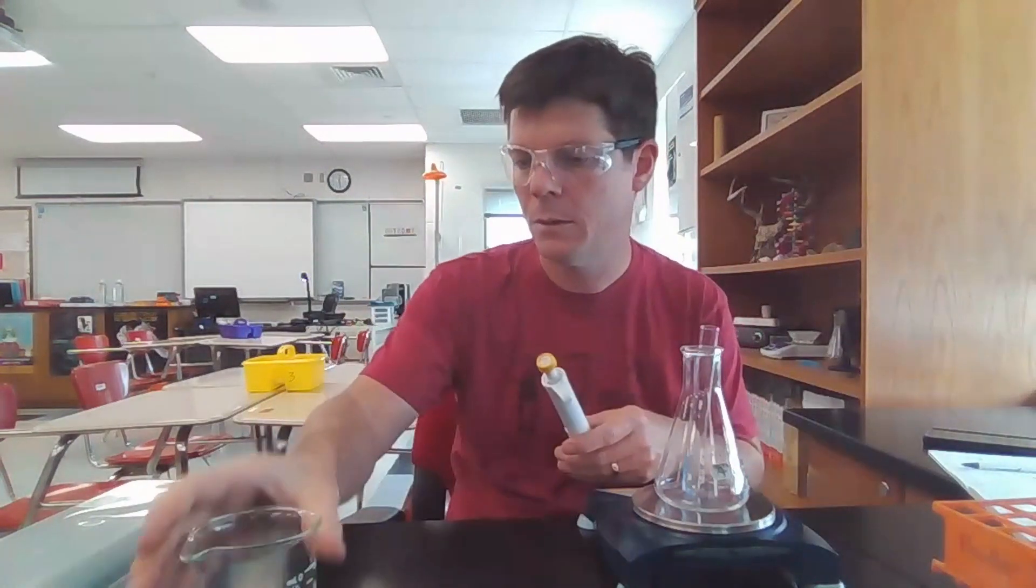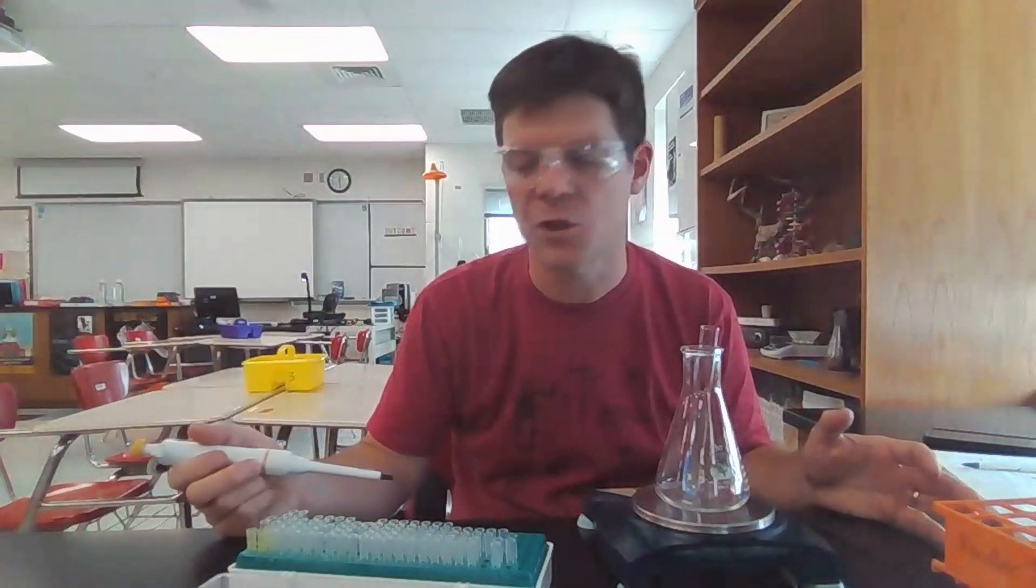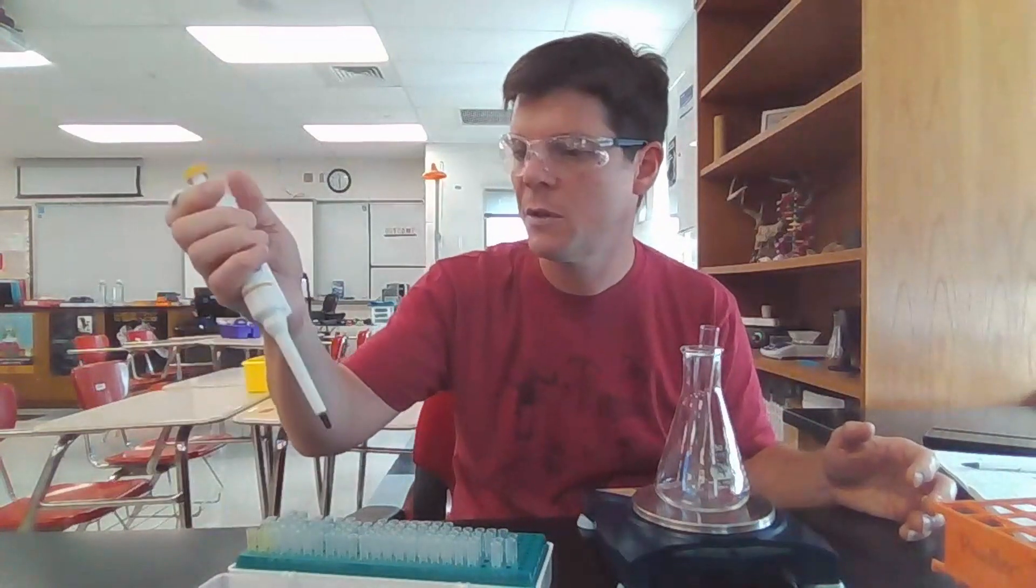Micropipette dialing into 200. For some labs, you would need to change tips after each transfer. For this experiment, I'm going to use the same tip throughout. I'm not really worried about contamination with this experiment. I'm just going to hold the micropipette in my hand like this.